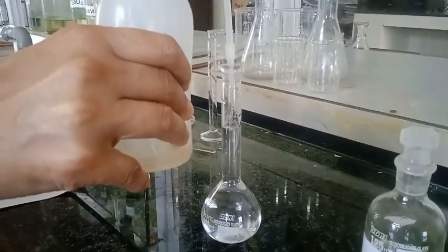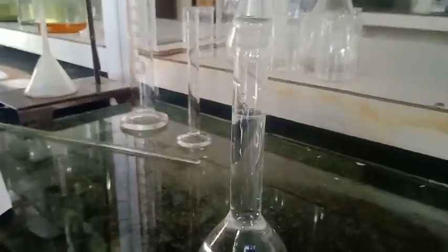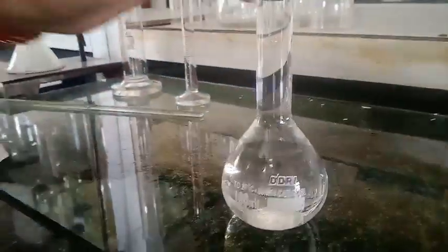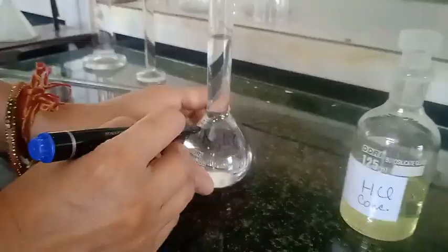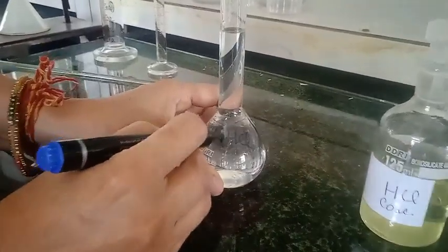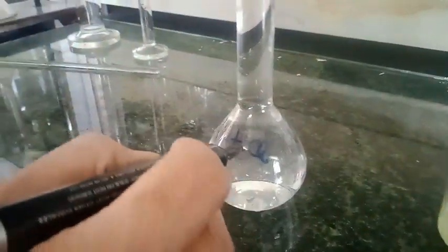So now this is up to the mark you can see here and this is how we can prepare one normal HCl solution. I shake it well and now I transfer it to the reagent bottle.